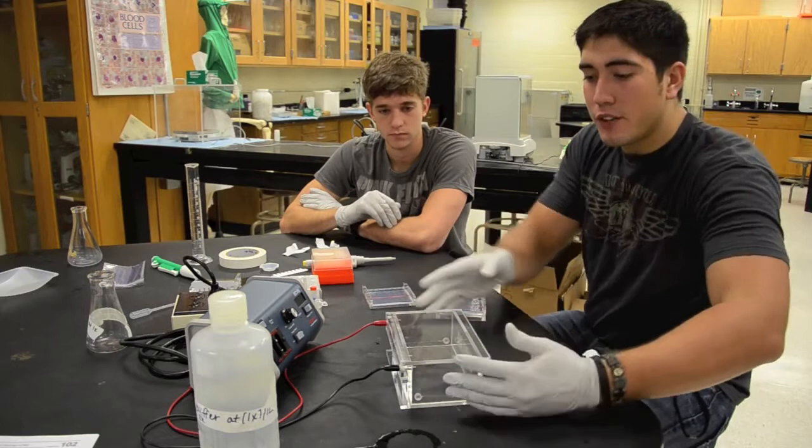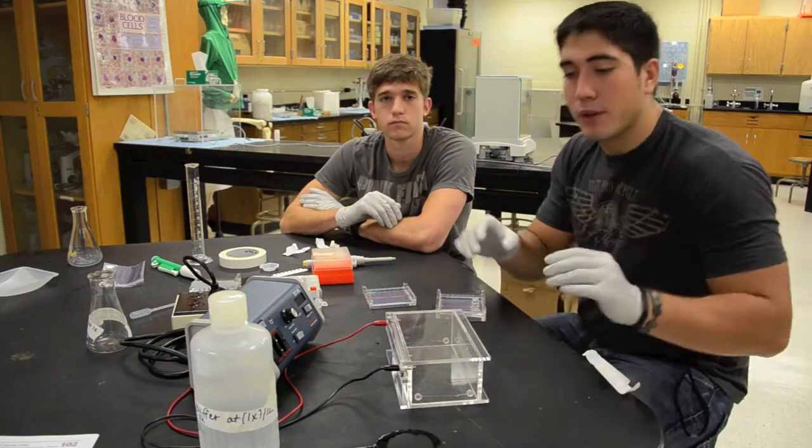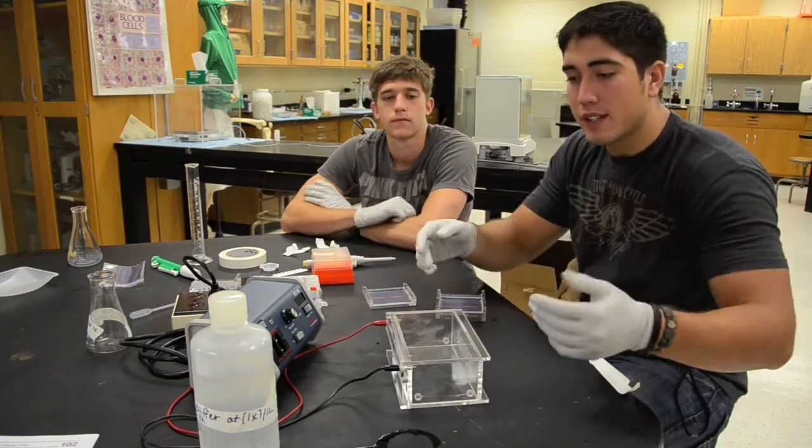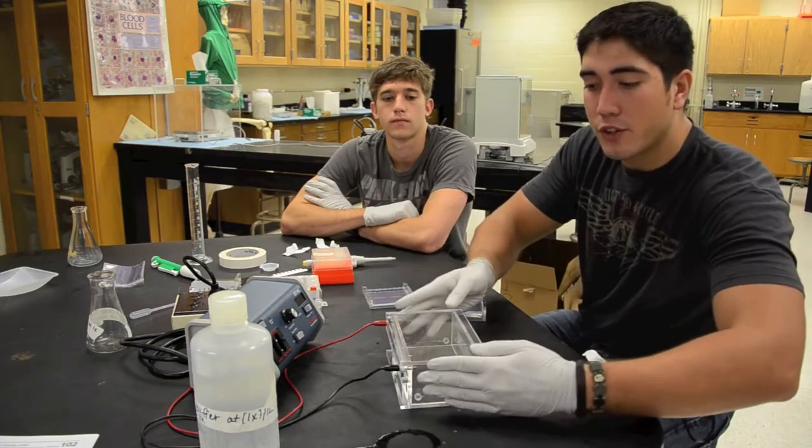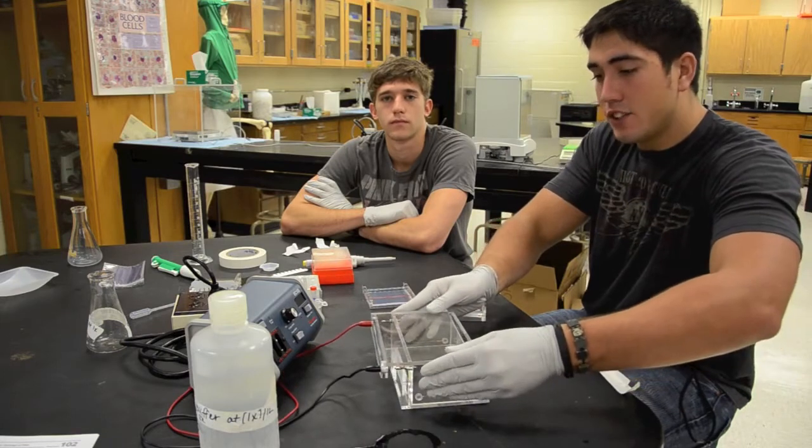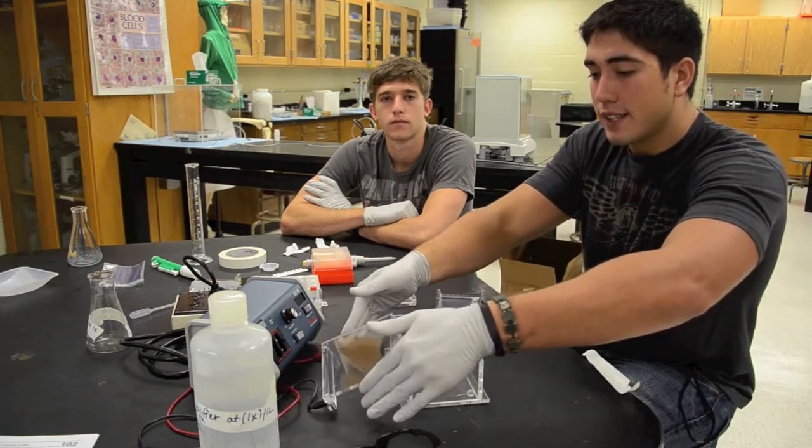The thick base one will go in first. Be sure that whenever you're taking the lid off of the chamber you don't want to lift directly up because these two studs, you'll break the chamber. So what you're going to want to do is slowly slide the lid of the chamber back, place the lid down.